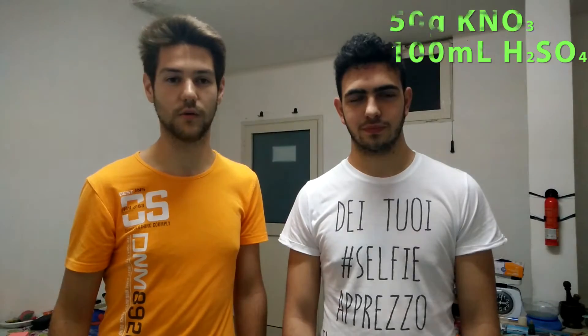In the boiling flask we are going to put 50 grams of potassium nitrate. Then we are going to add 100 milliliters of sulfuric acid. After this we just have to heat up the mixture until it starts boiling.